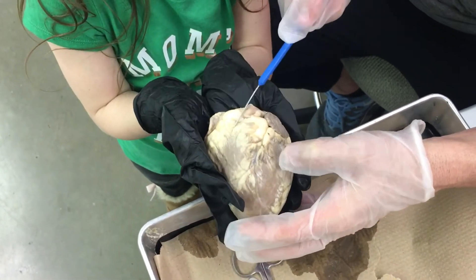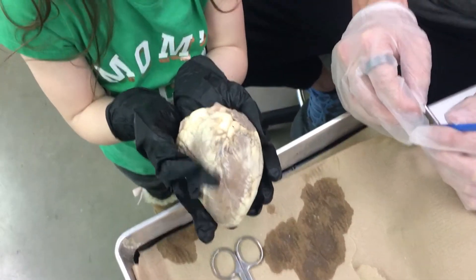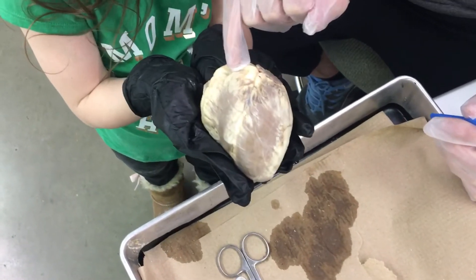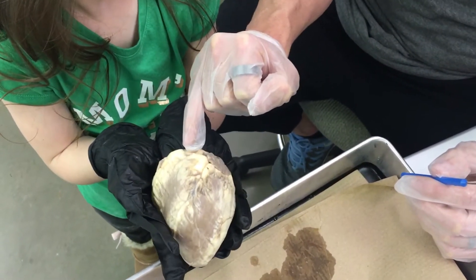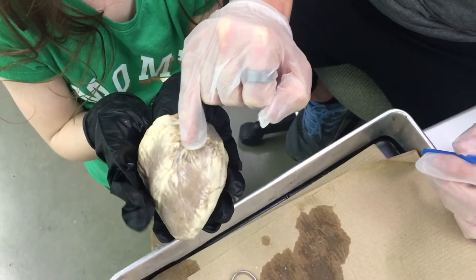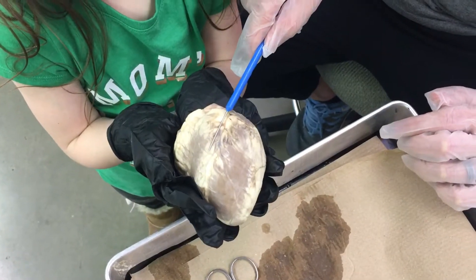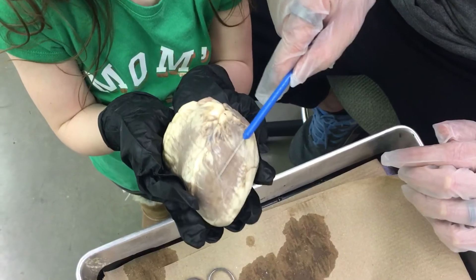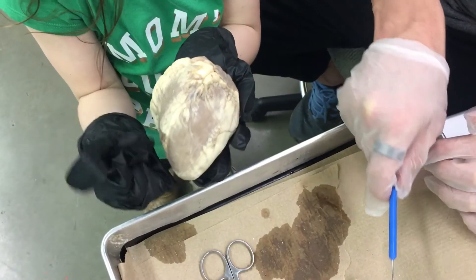Inside this adipose tissue you have your coronary arteries, and those are the arteries that when blocked cause a myocardial infarction — an MI or heart attack. The right coronary artery goes this way. The left coronary artery comes off the aorta and goes this way, and it has a branch called the left anterior descending. That's called the widow maker because a blockage there deprives oxygen to the left ventricle, which pumps to the whole body in systemic circulation.